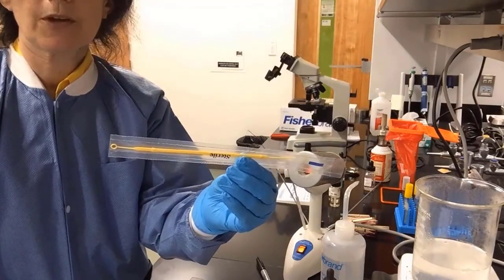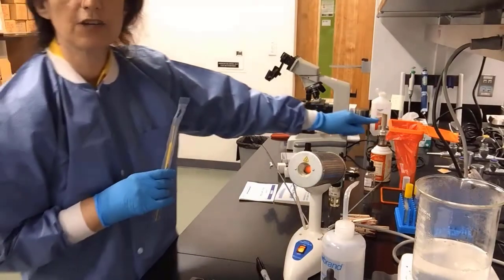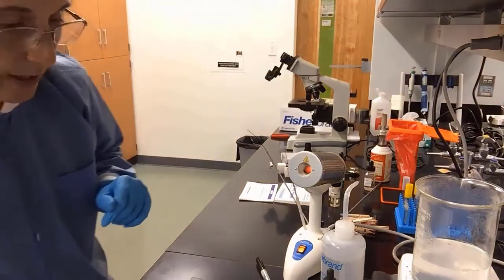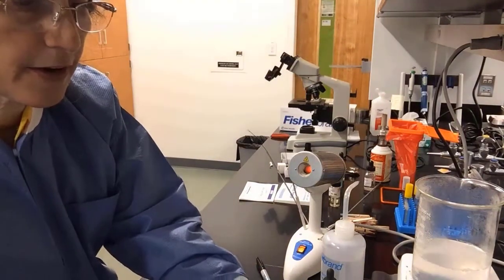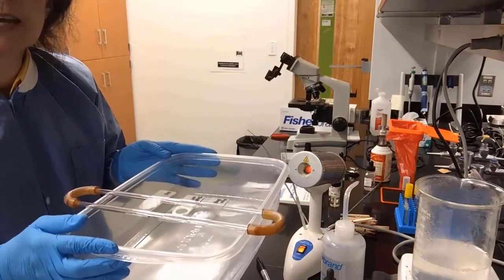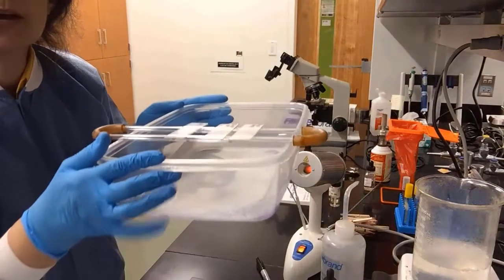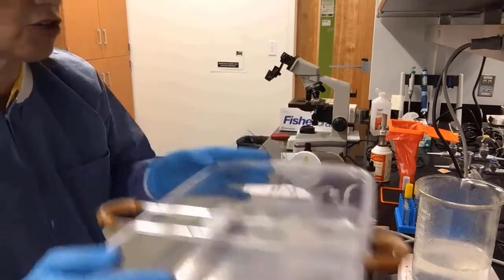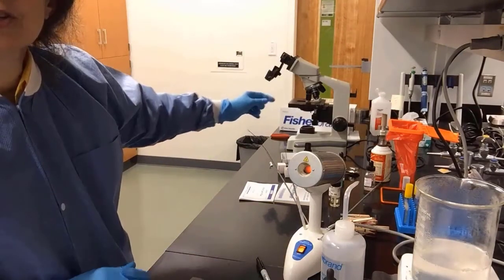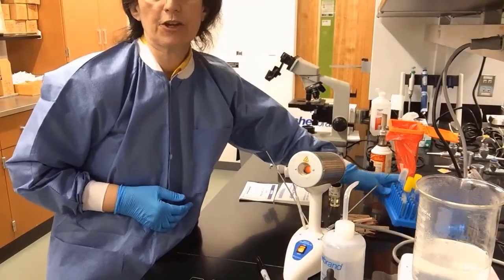Some instructors may use a disposable loop. In this video, we will use the metal loop. If you use a disposable loop, just make sure you put it in the hazard trash. Let's get started. Here's our staining rack. You can see some slides drying on the staining rack. You'll notice also that there's a Tupperware under the staining rack to collect all our stains and our waste during the staining procedure. We have a microscope back here so we can view our specimens after we stain them.